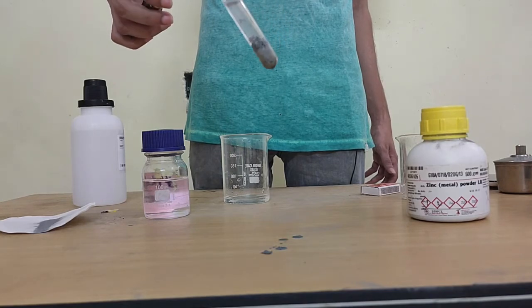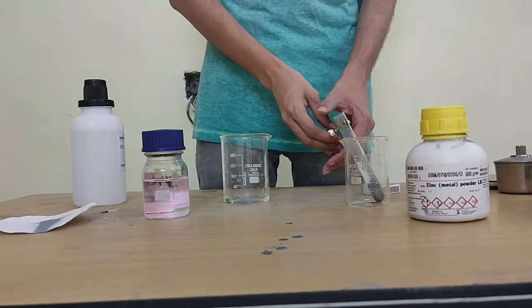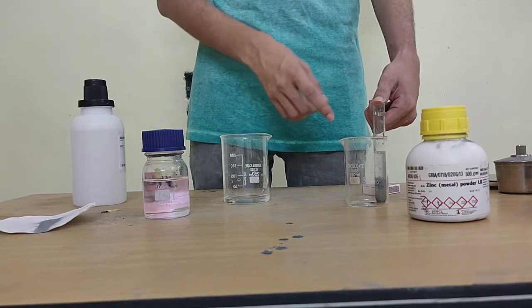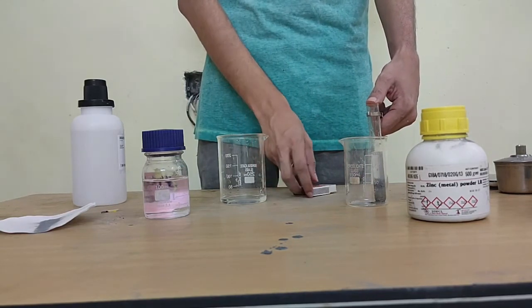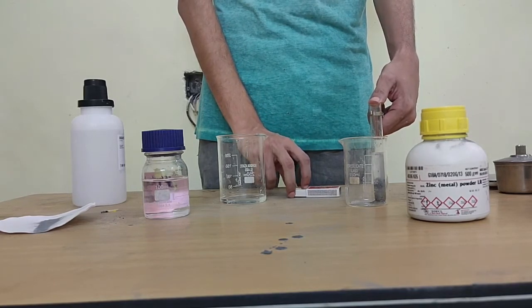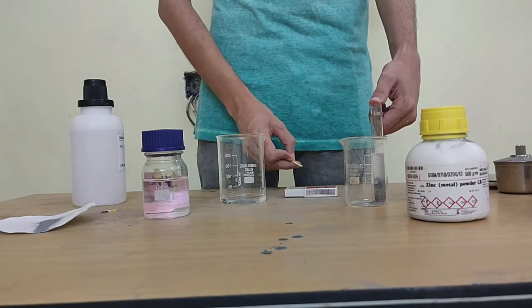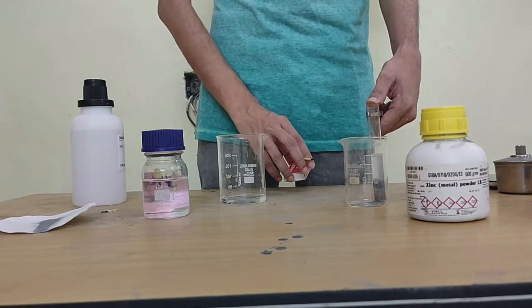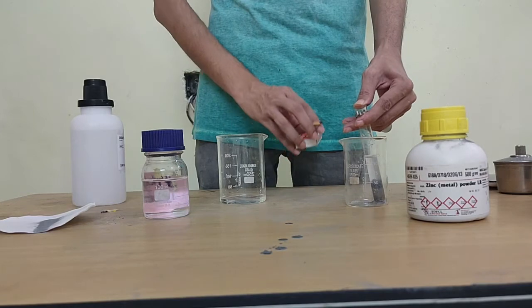All right, now what I need to do is to test this, I'm going to just cover this up slightly, okay. I'm going to cover this test tube so the gas stays inside the test tube. So for identifying which gas it is, there are a lot of tests. We can use any one that we wish. One of the tests for gases is called the pop sound test, okay. It is used to identify whether a gas is hydrogen gas or not. Okay, so we'll be using the pop sound test.